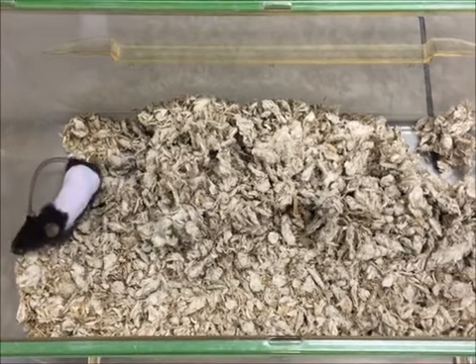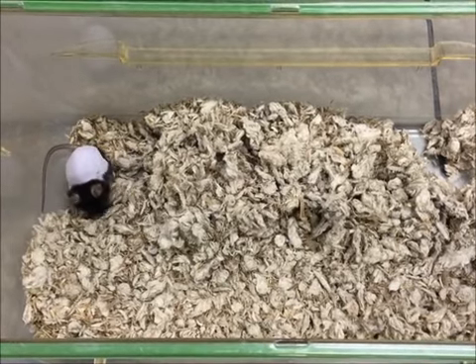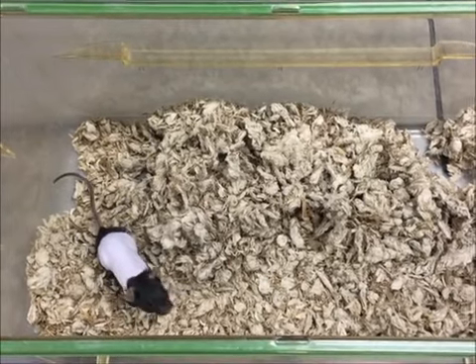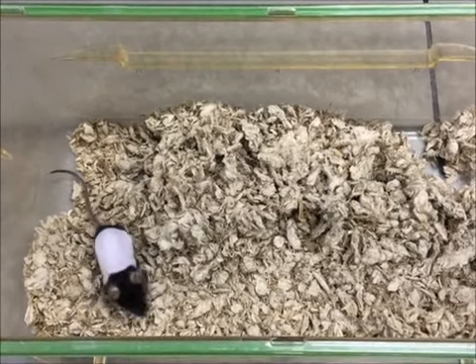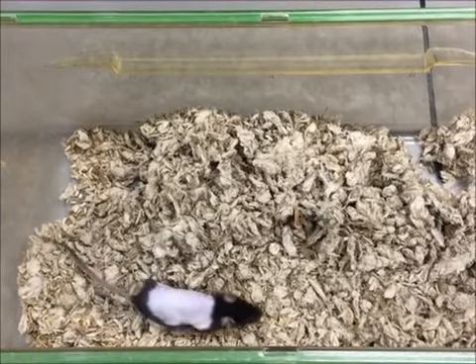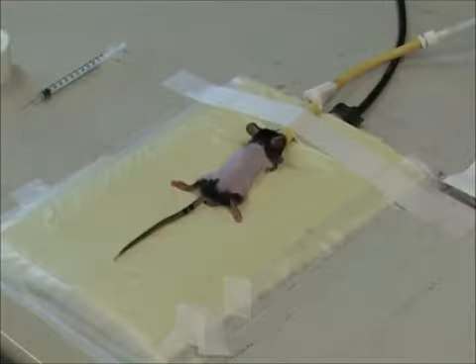Therefore, it is recommended to monitor the mice for skin changes and to contact the veterinary staff for care if needed. Also test the tolerance on a small batch of any new strains of mice to start with. To avoid hypothermia, the mouse is placed on a heating pad.